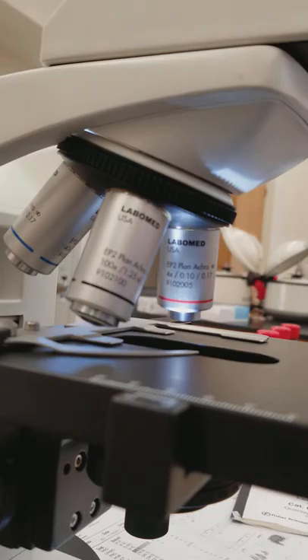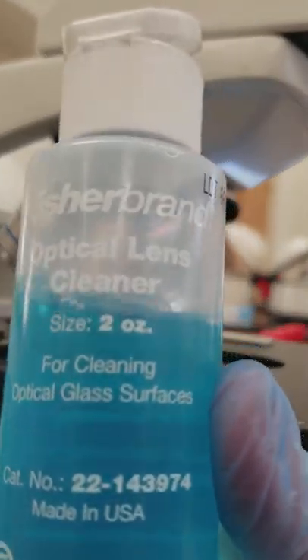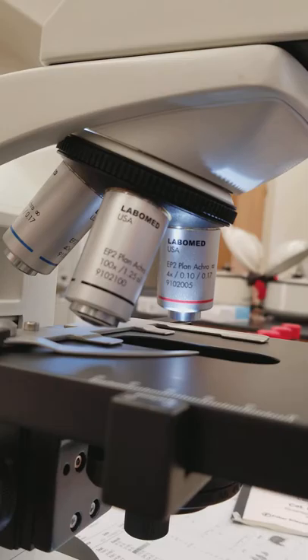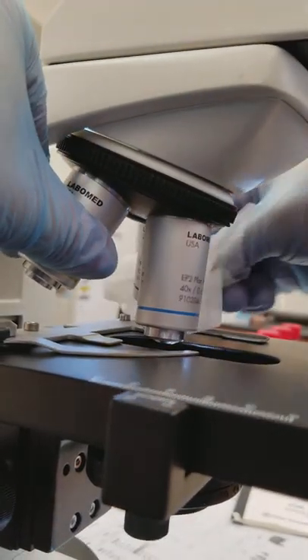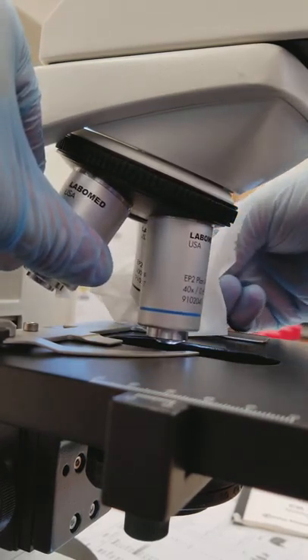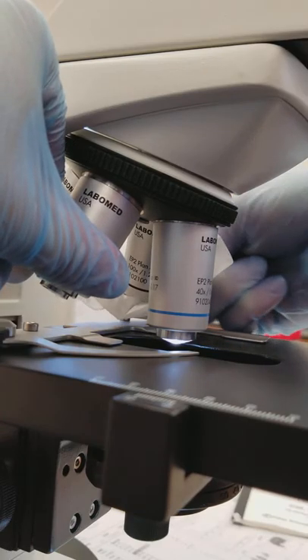We had a Fisher brand lens cleaner earlier and it ends up being completely affected by the light if you let it sit out too long and exposed to the light. So what we did was we replaced it with Windex and that works just as well.